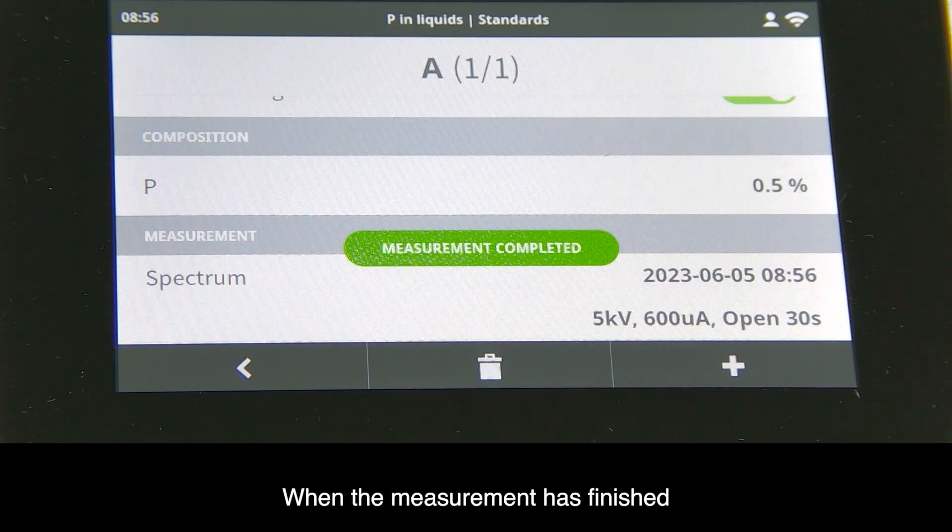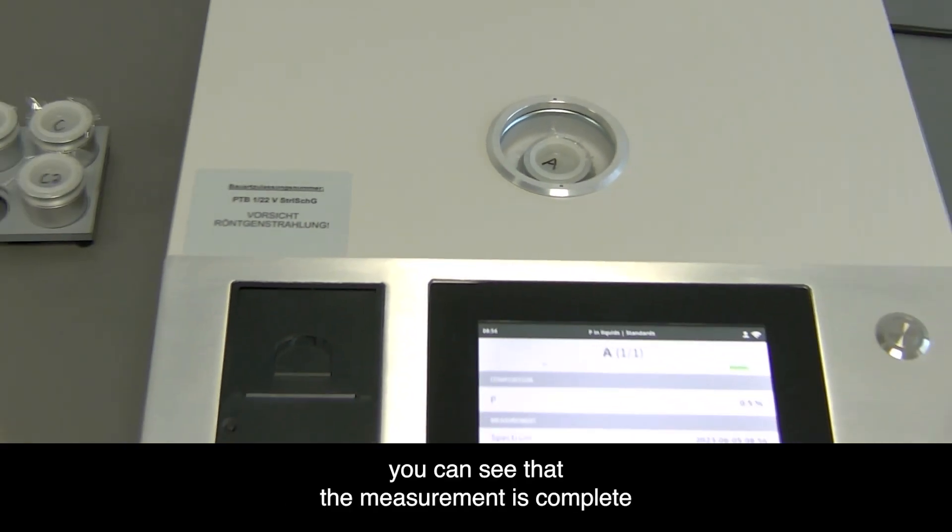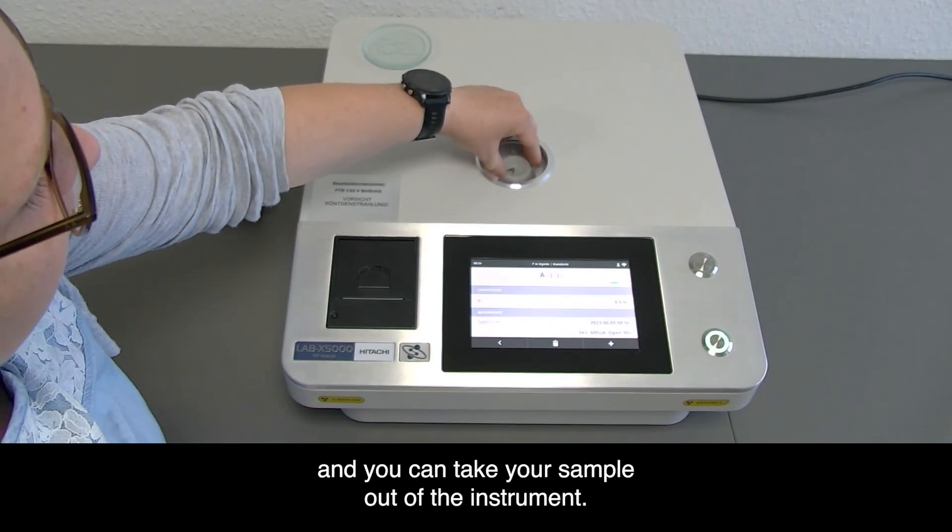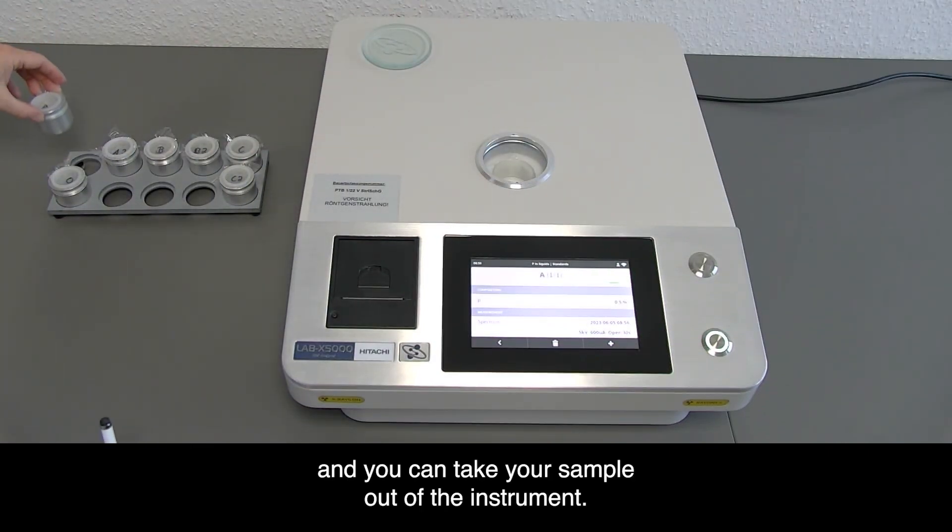When the measurement has finished, you can see that it's complete and take your sample out of the instrument.